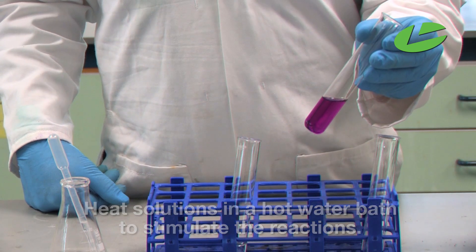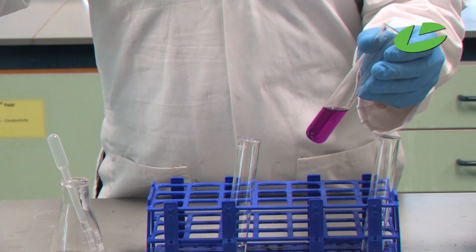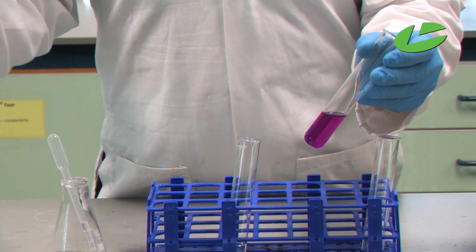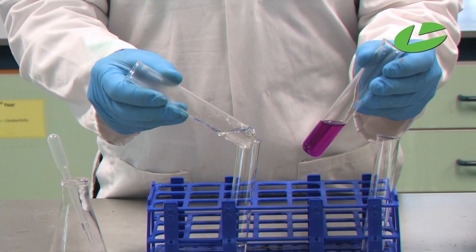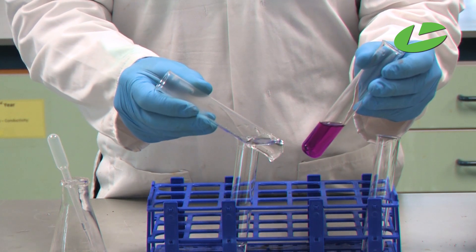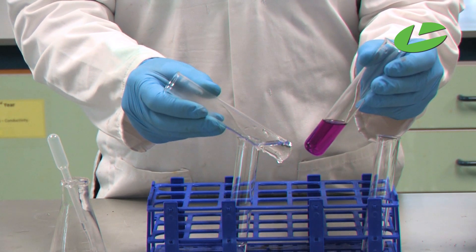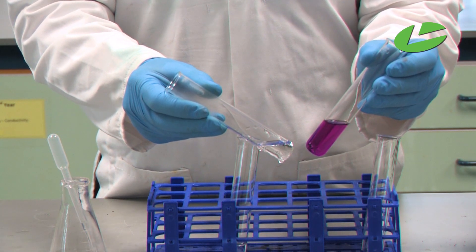Here I have my potassium permanganate before the reaction, and here is the solution after, and as you can see it has turned totally colourless, indicating the presence of an aldehyde.